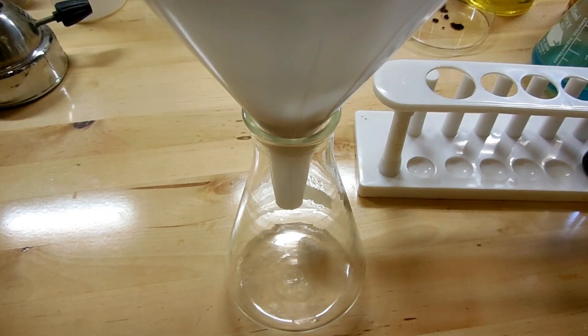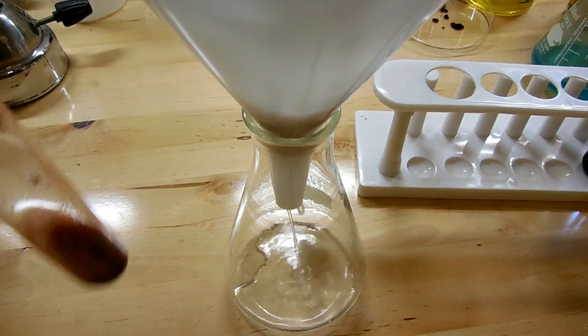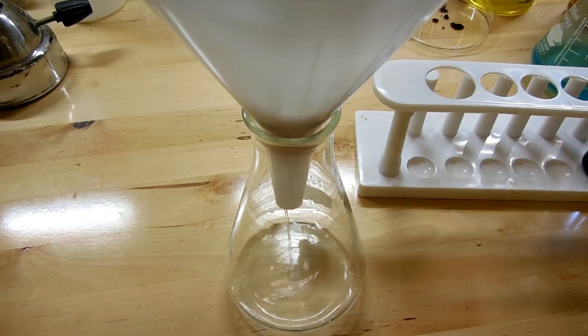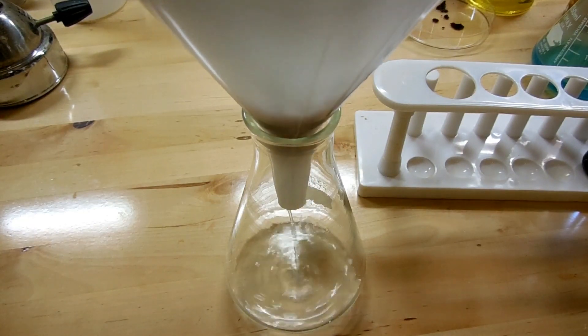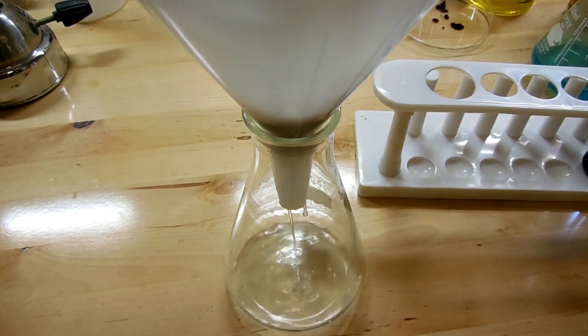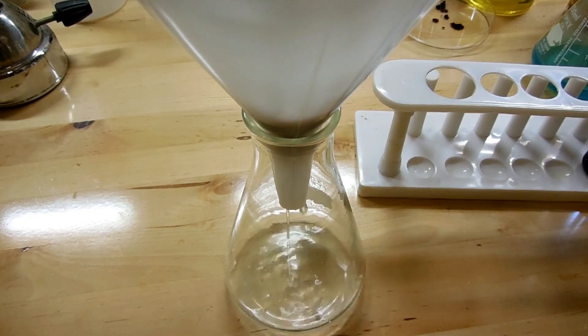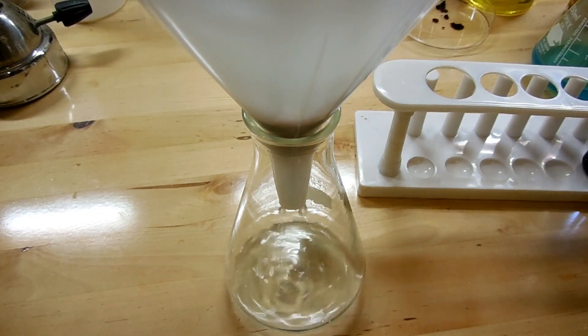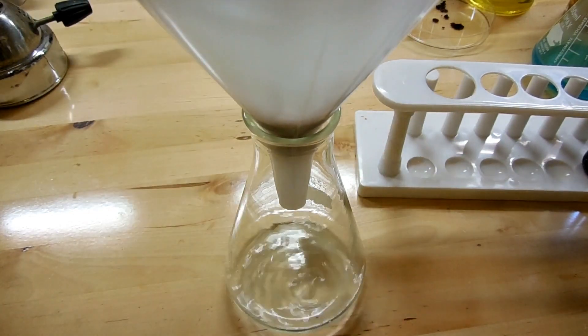Actually when I was boiling this solution I ended up taking it outside to do the majority of the boiling because it releases more sulfur dioxide as you're boiling it. So I just wanted to be safe so I took that outside to finish it. And if you try this I'd recommend you do the same for the entire procedure.